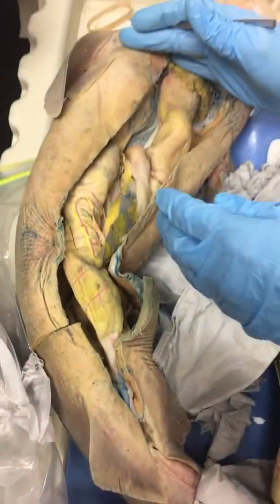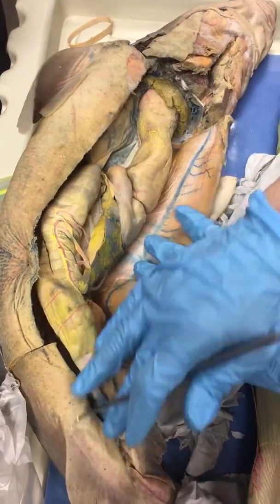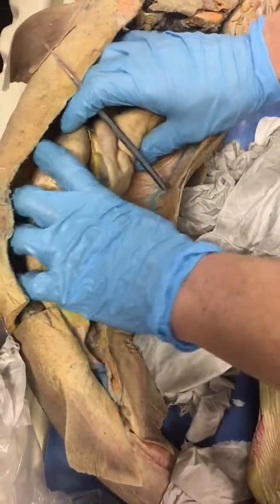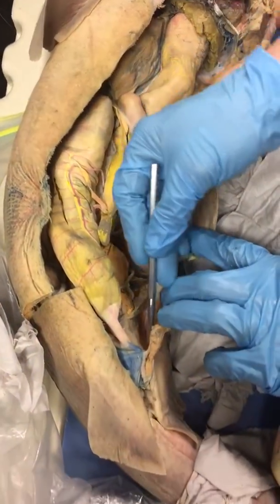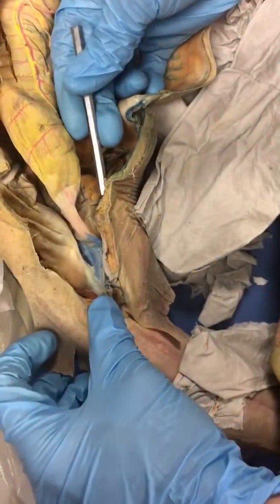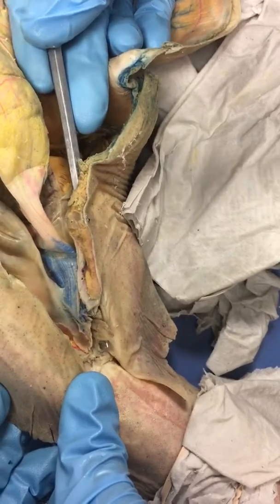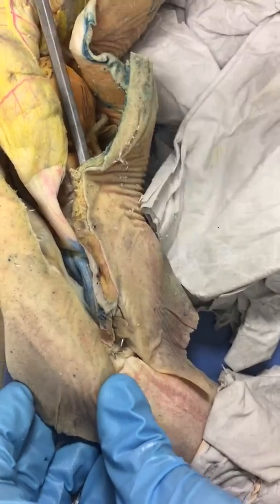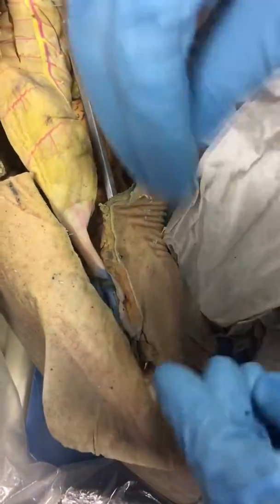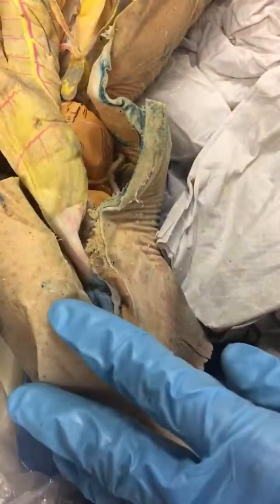To go back a little bit, the pleuroperitoneal cavity is basically from the top of the liver down, that internal body space that all these organs reside in. And the abdominal pore is this little hole here, which allows the inside of the body to have direct access to seawater, or maybe internal fluids to leave the body. So it helps with internal body pressure.